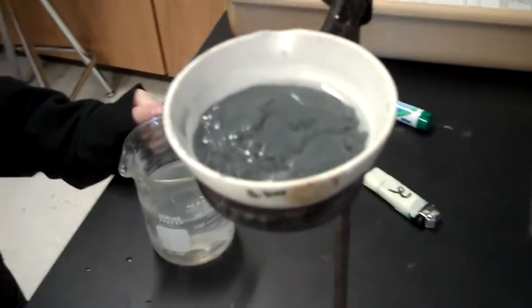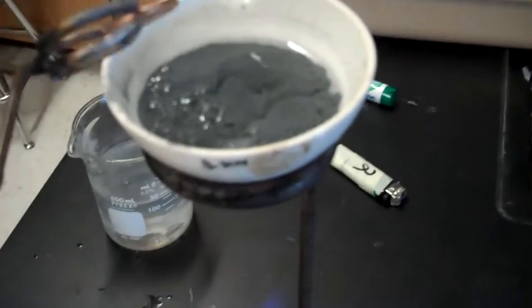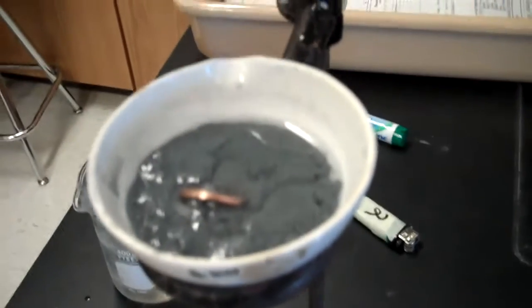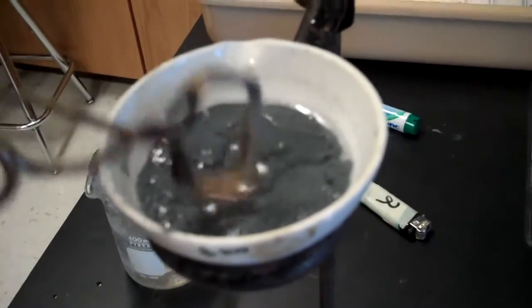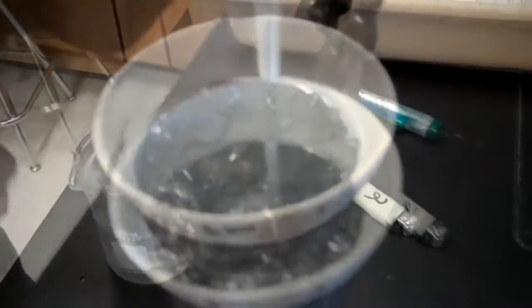Now Sarah has sanded the penny, and she's going to drop it into a mixture of zinc hydroxide, well, excuse me, powdered zinc with sodium hydroxide, and it's very warm. It's not boiling. It's just very warm.